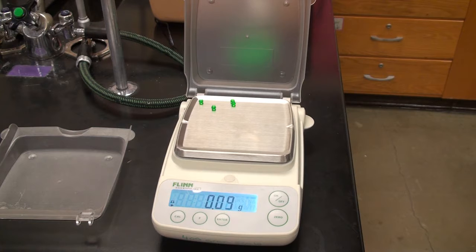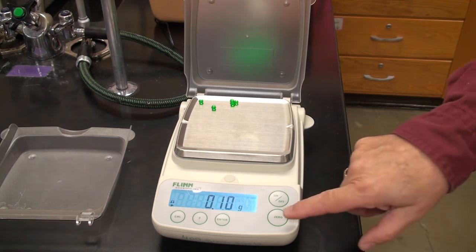There's a little ventilation on in this room. That might be what's throwing us off a tiny amount. That looks pretty stable though. Here's number 5. All right, that looks stable.